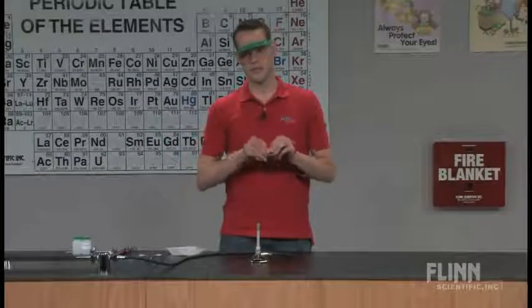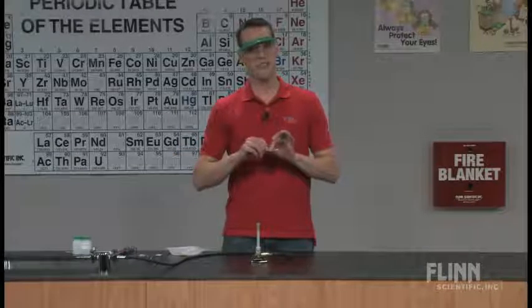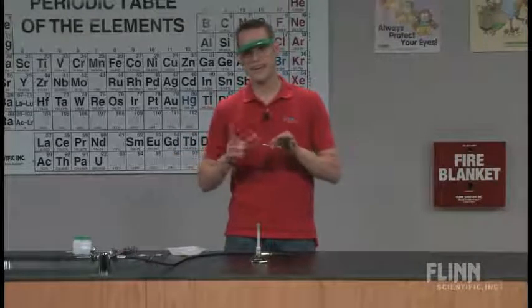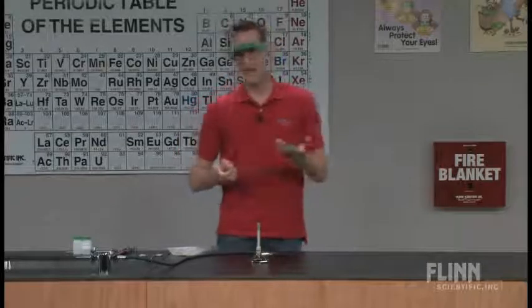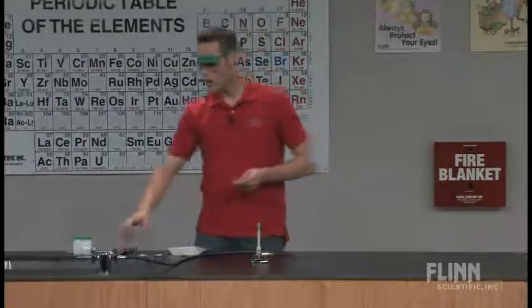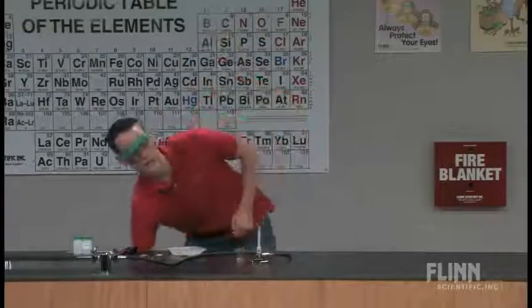So I started doing this with all of my Q-tips and I would cut them in half first before they get into the lab. And then they hold them with the crucible tongs in the flame. That way they can't waste one half of it when they're not using it. So all they do is they have some distilled water or deionized water.